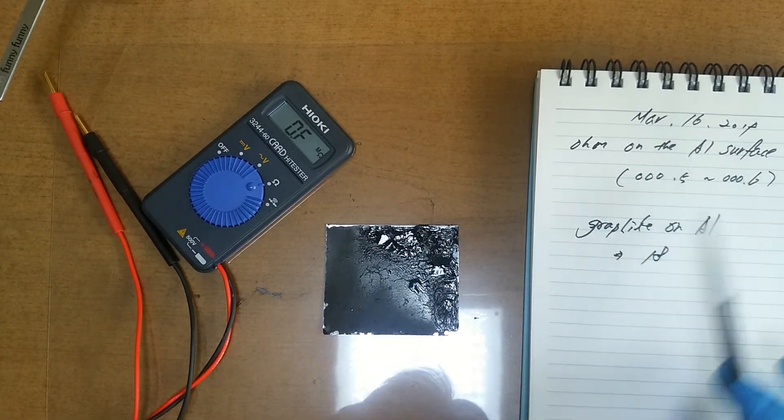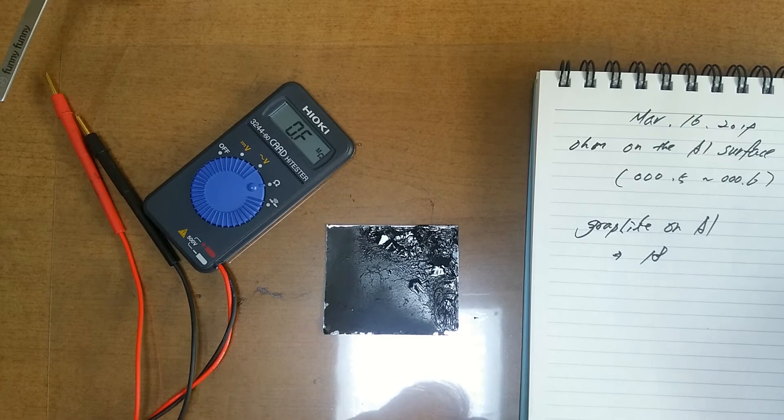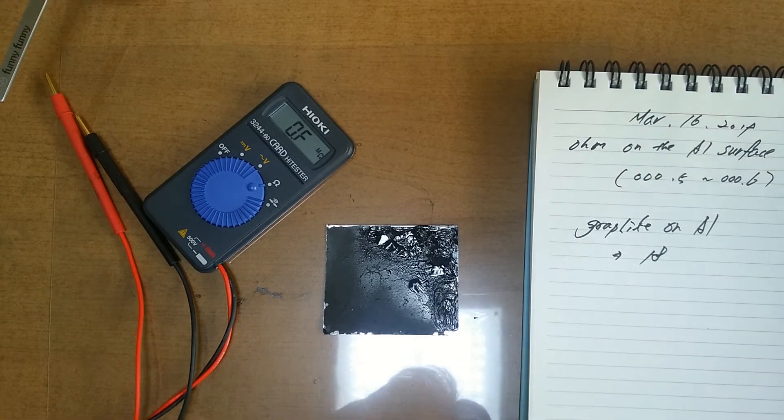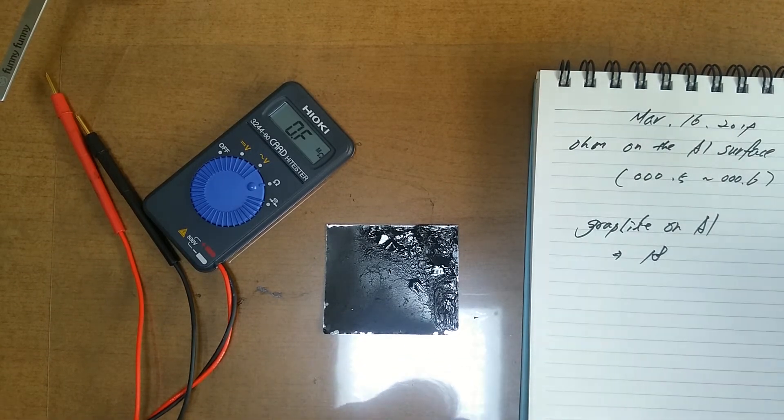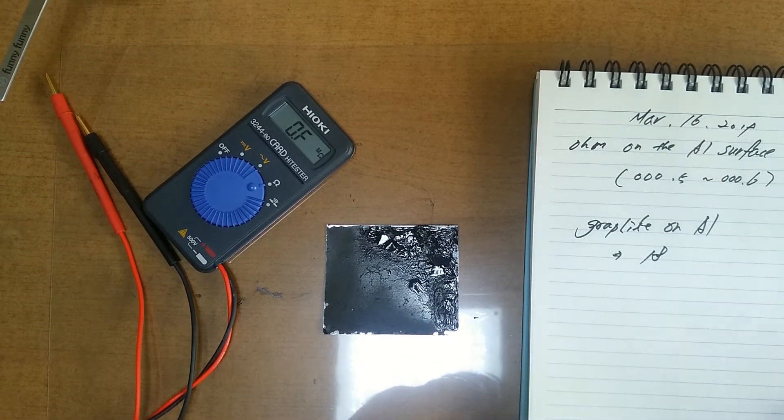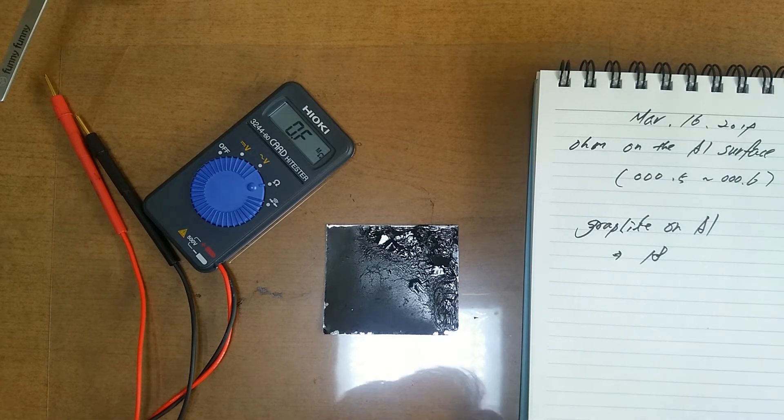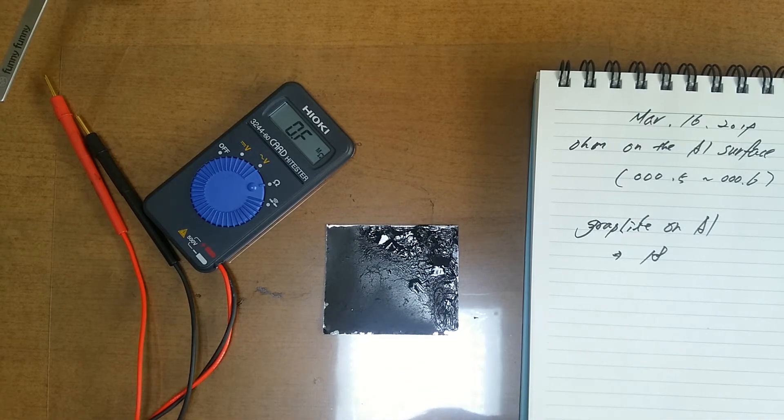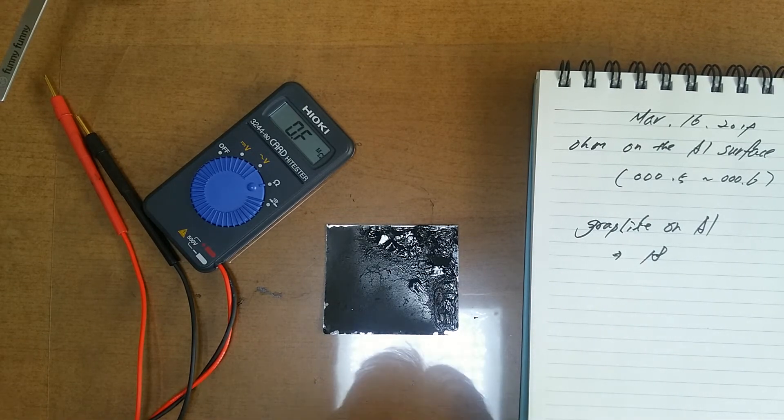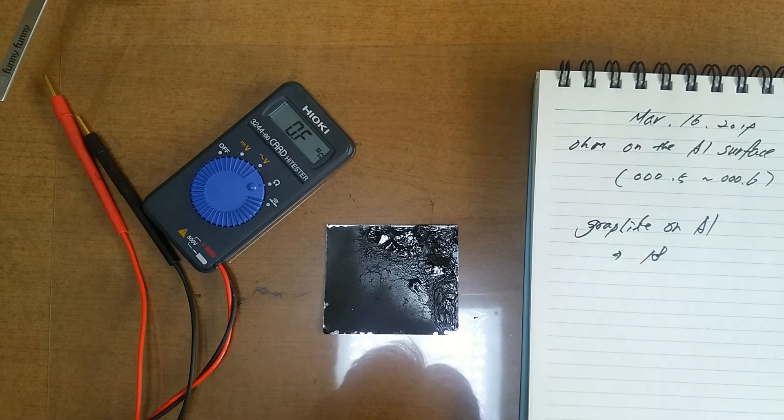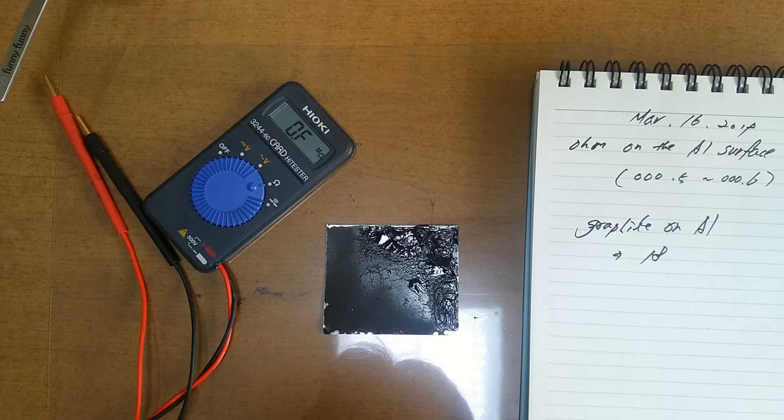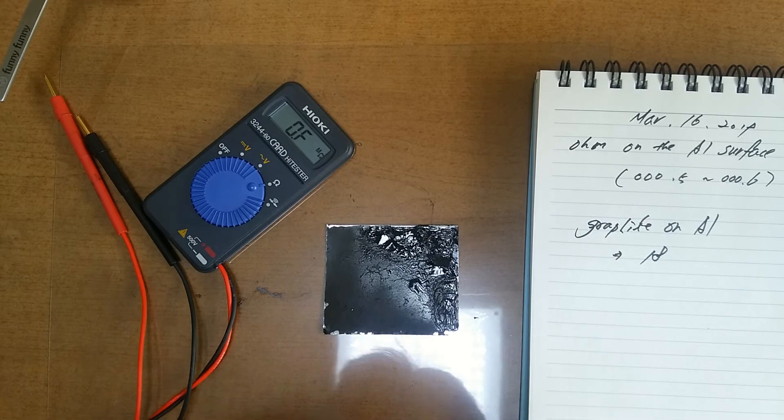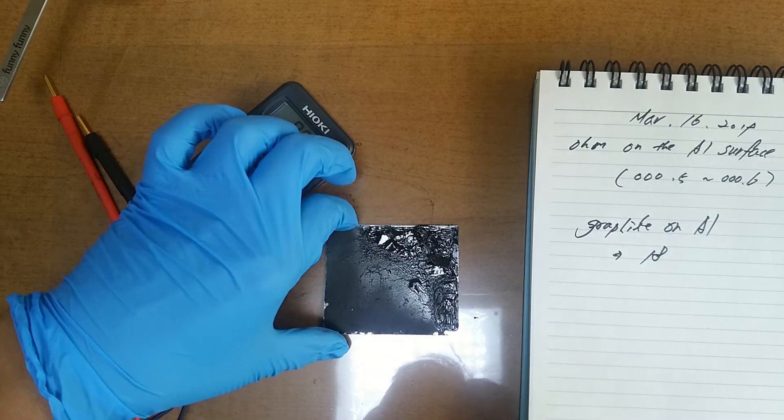18. The gap is really really big. But this experiment is very fun, so I'll keep doing it. Perfectly spoiled.